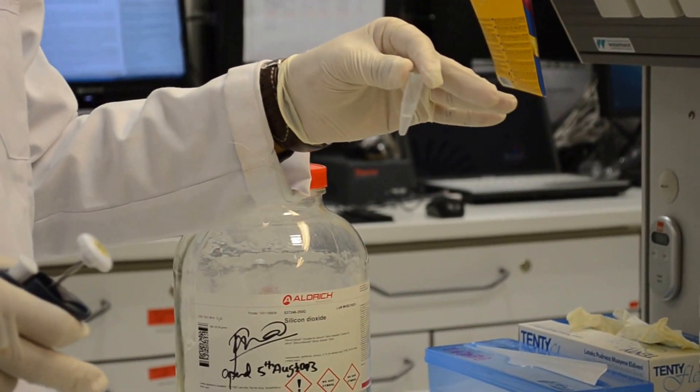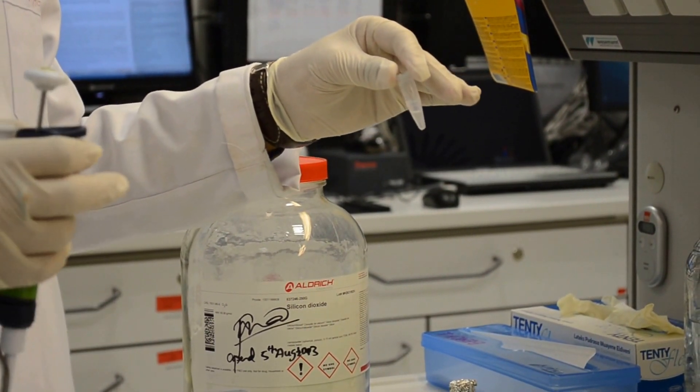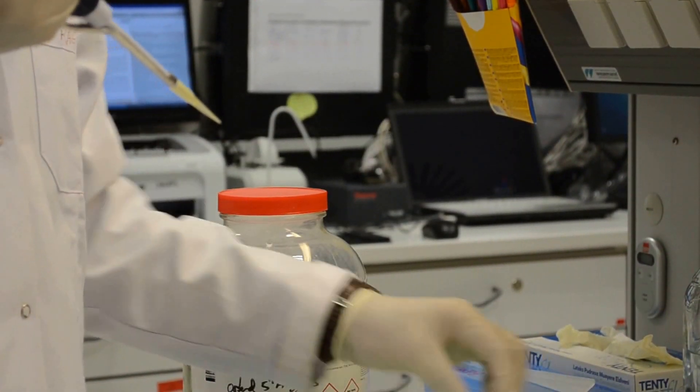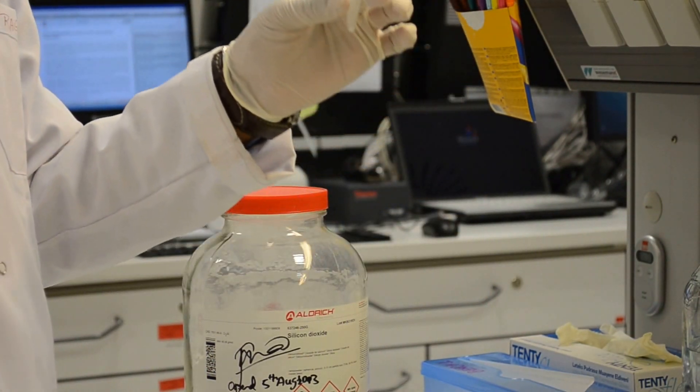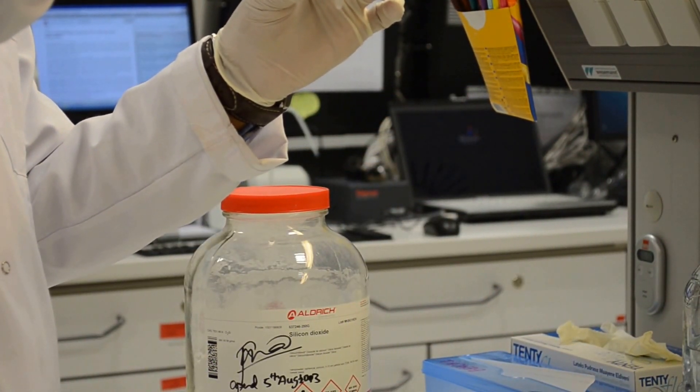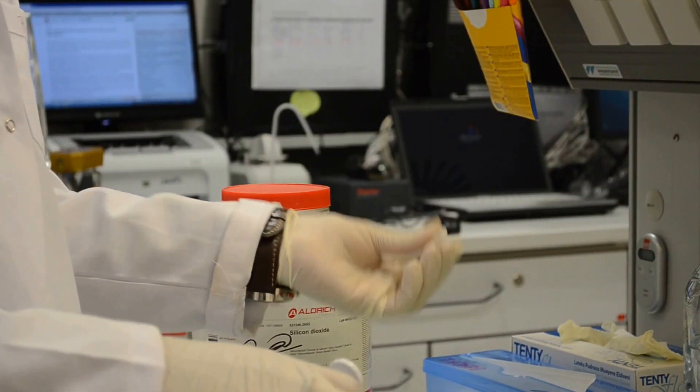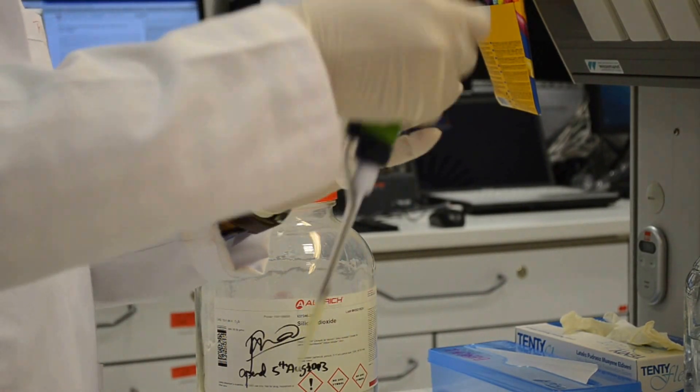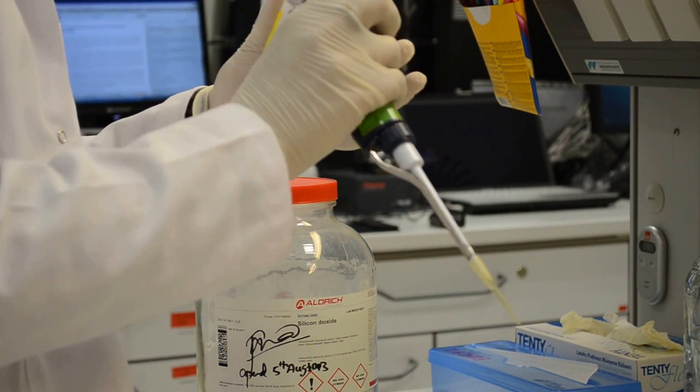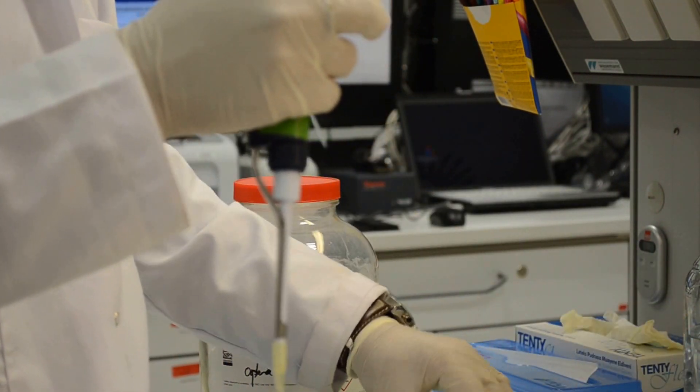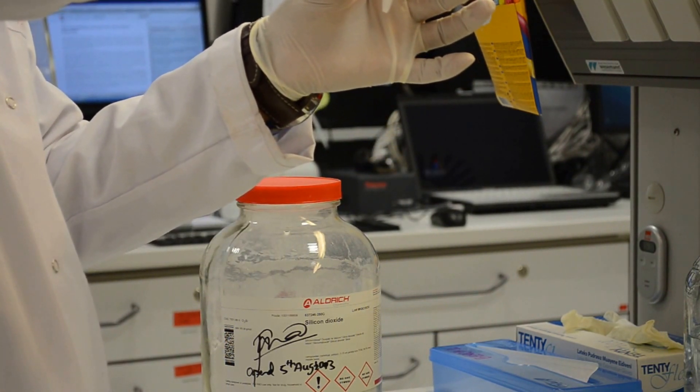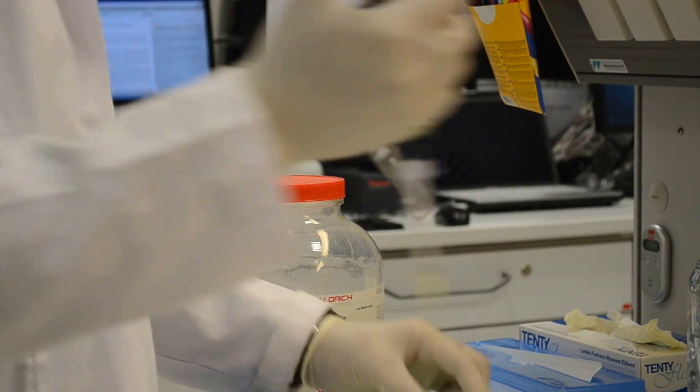This is the reagent that we developed. It will be added to the test sample. The test sample and the same amount of distilled water will be added to the control sample. A similar identical volume of water will be added as a control, which do not influence the quantum dots to go into the porous structure.